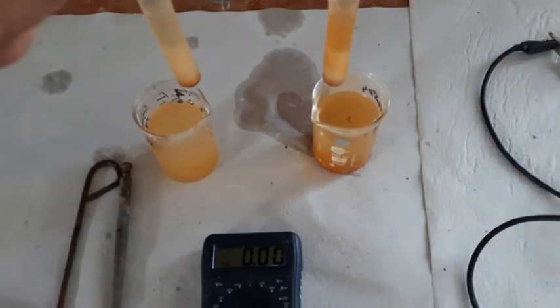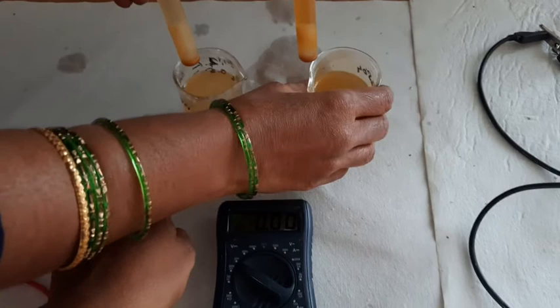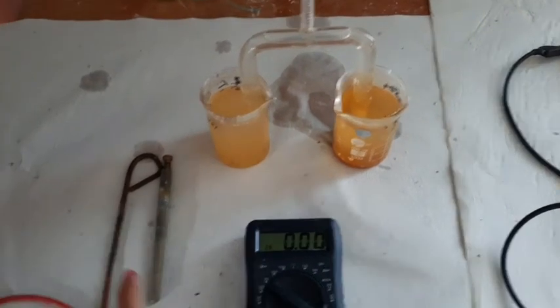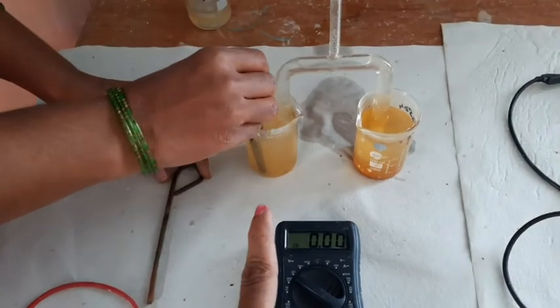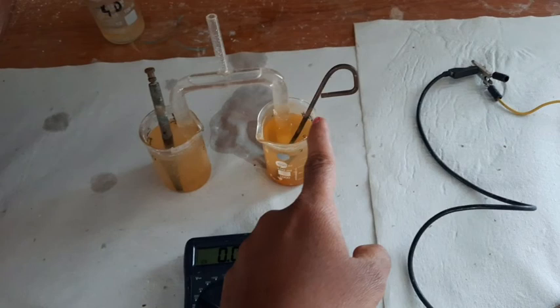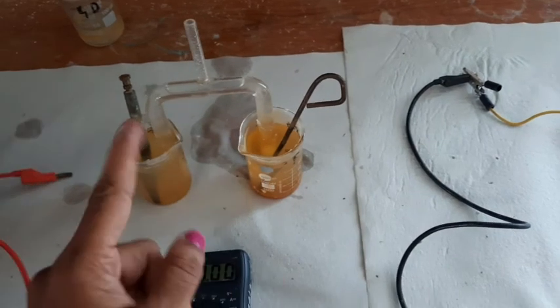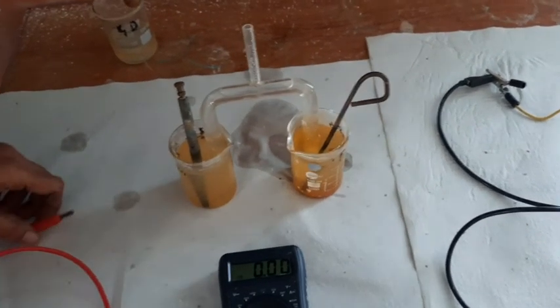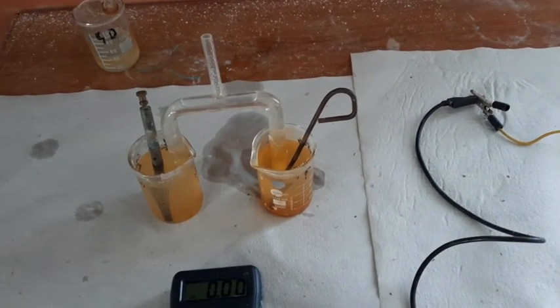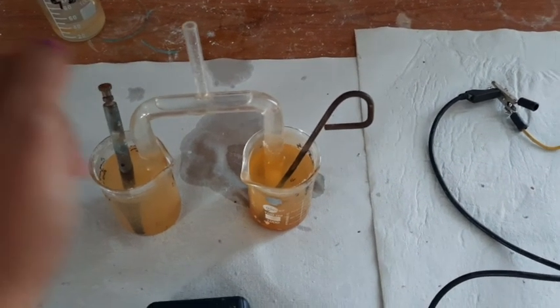In the zinc sulfate solution (1 molar), we immerse the zinc electrode, and in the FeSO₄ solution, the Fe electrode is immersed. As already seen, zinc is above Fe in the electrochemical series, so Fe acts as cathode and zinc acts as anode. The anode has a negative charge and the cathode has a positive charge.